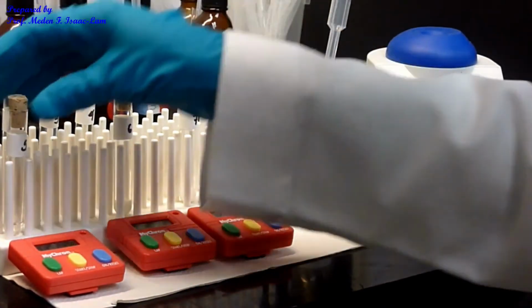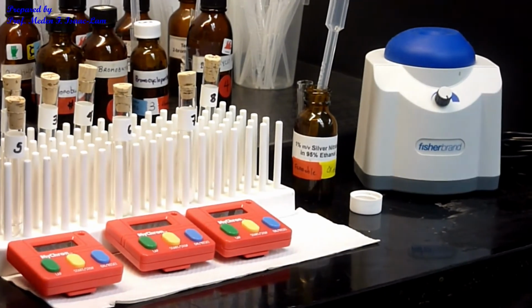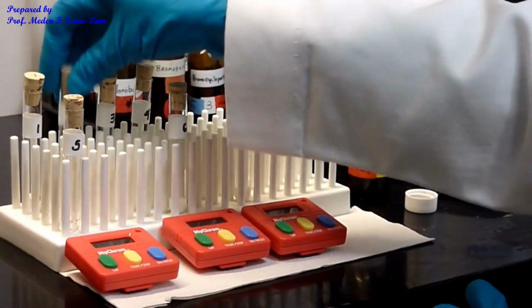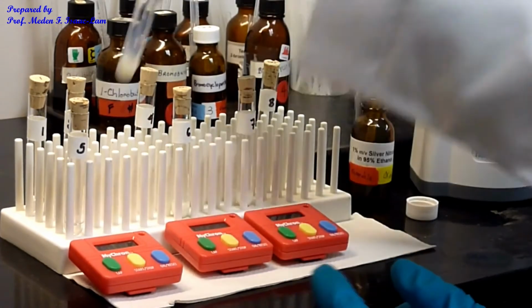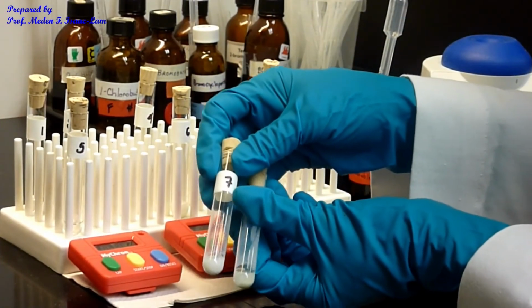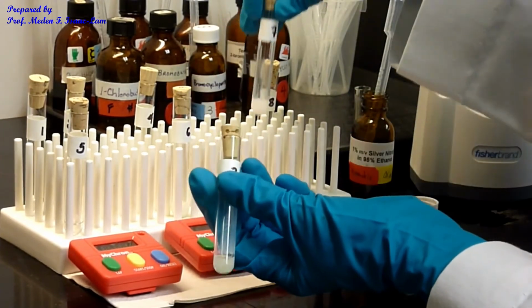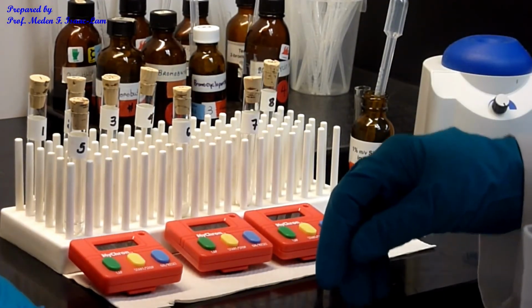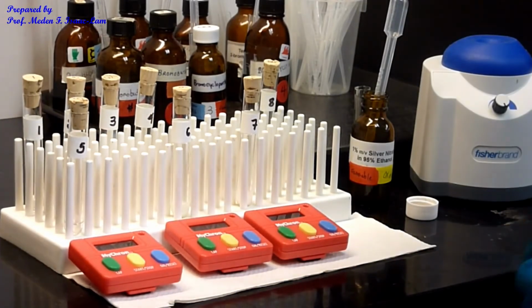So this one, nothing's going on, 5. As well as 1. 2 has some, 3 the most in here, and we're gonna compare 3 and 7. So 7 actually is much more, it was faster than 3. So it's been almost 11 minutes for the first one, okay, since we started.